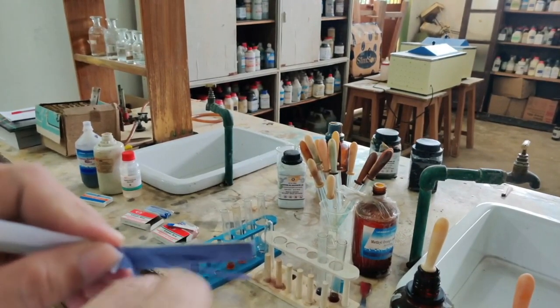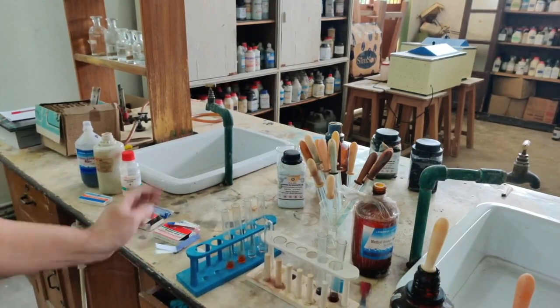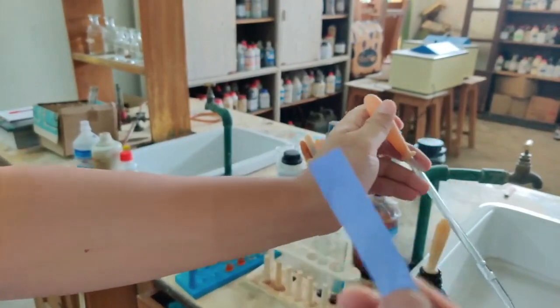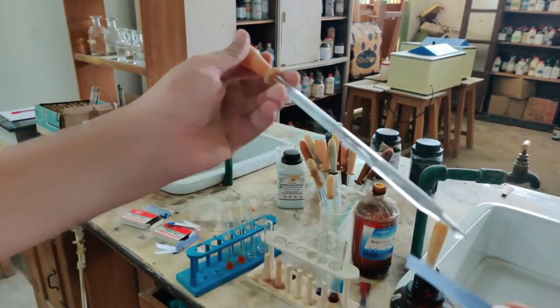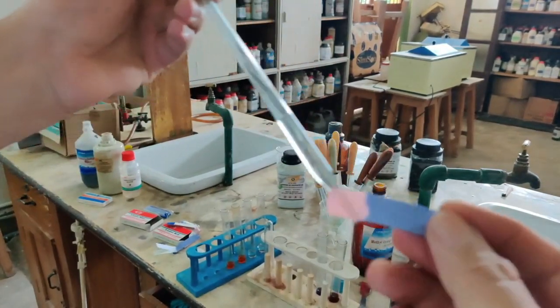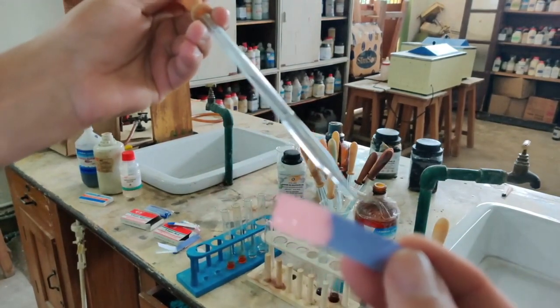So let me take one strip. If I take one strip and test with the acid, let's see what happens. Here I am taking the same acid now, dilute hydrochloric acid. Now notice what change in color is noticed with this litmus. See, I am adding this. So you can see that the color of the litmus has turned to red. So blue litmus turns red.